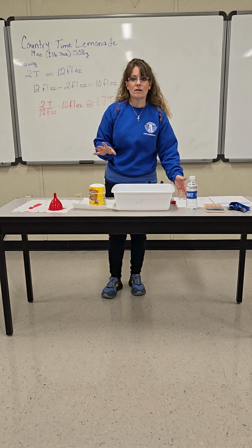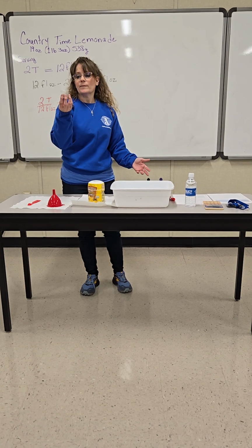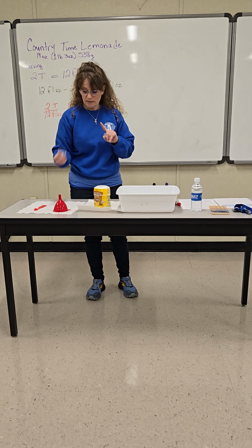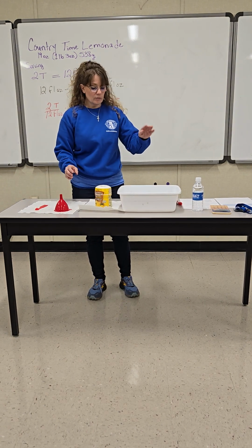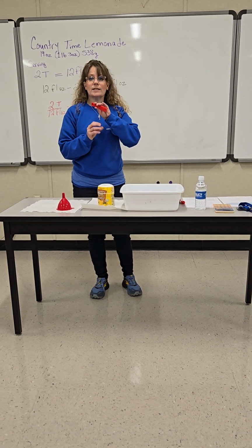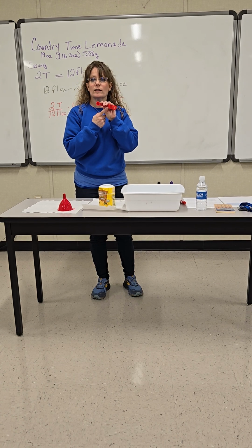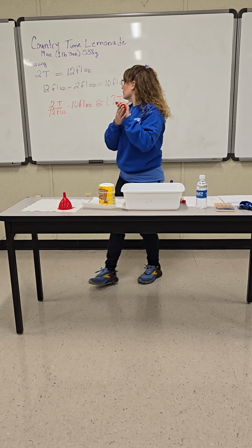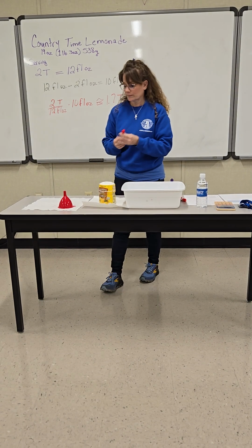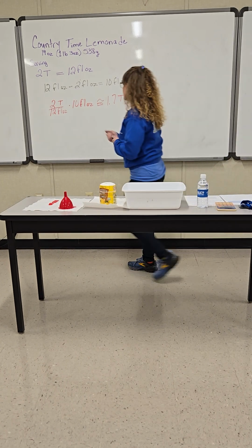But before I do that, I check all the materials that I have to work with. I have my measuring cup. I have a 30 milliliter, 1 ounce measuring cup, so I know I'm going to dump 2 out of these. I got my funnel that I'm going to use to pour what I need in there. But my supply is measured in teaspoons, not tablespoons, and I got a 1/4. So now I need to convert this from tablespoons to teaspoons, right? And I only got a 1/4 to work with. So before I start doing that, let's get this one figured out.